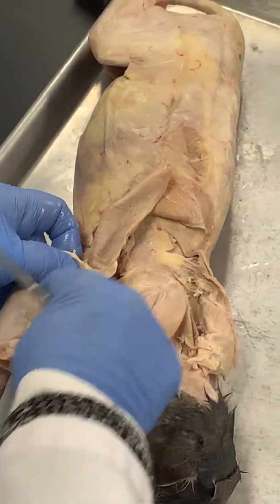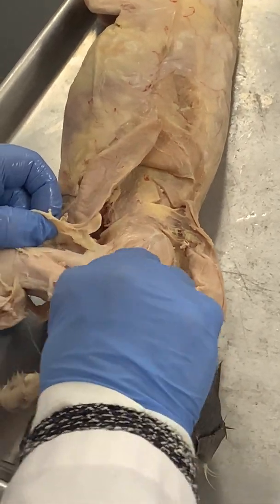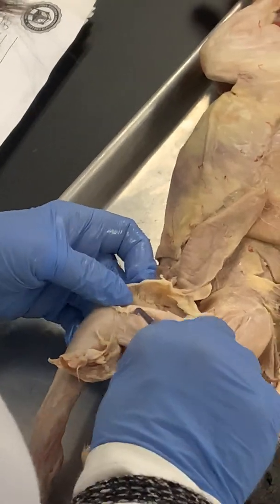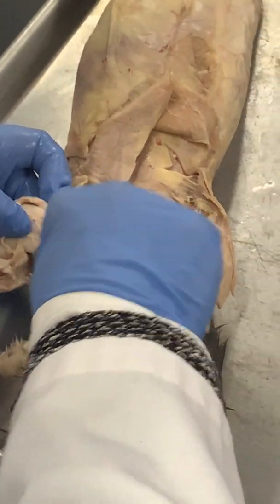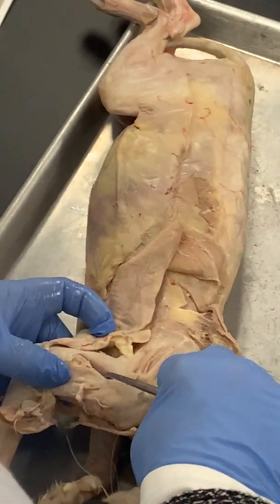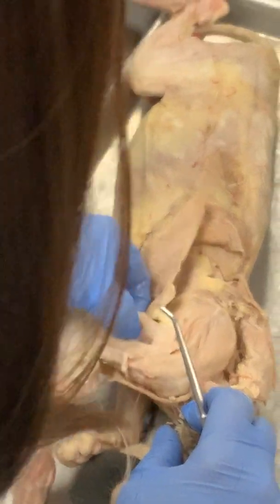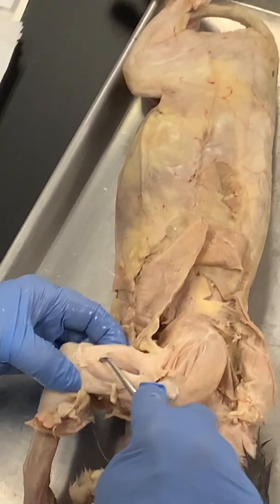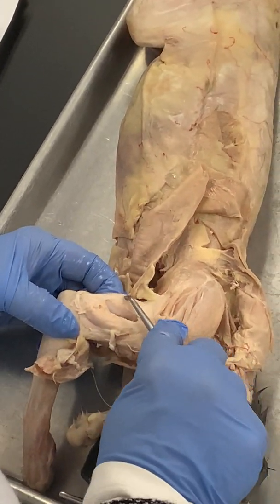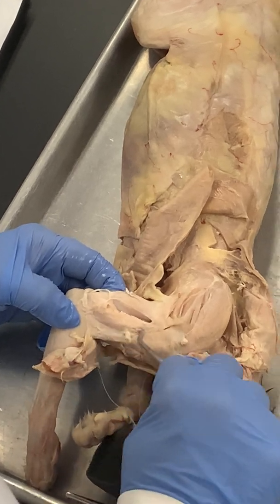The lats go in and insert on that humerus. You have to be patient — there's the bone. Your triceps has three heads but you see this big belly here? That's triceps — that's the back of the arm. And if I pin it, that's all you have to put: triceps brachii.